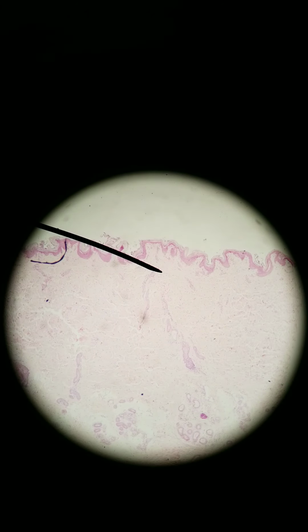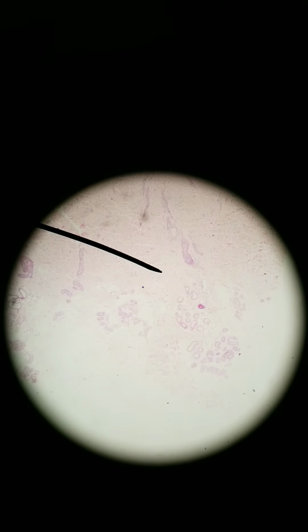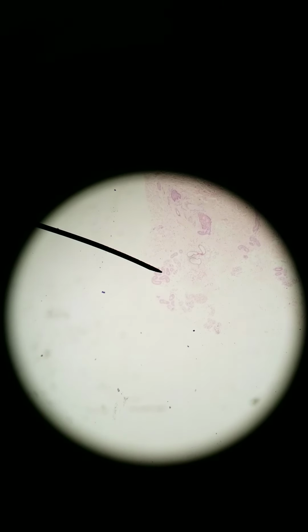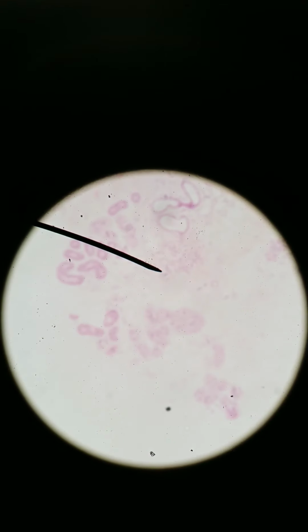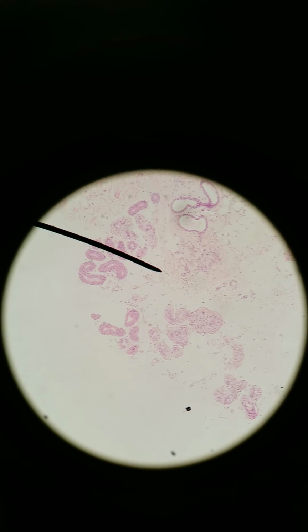Okay, so here we're looking at skin from the axillary region, the armpit. You can see our epidermis at the top and dermis and hypodermis at the very bottom. You'll hopefully already notice that there are some glands that have small lumens, like the eccrine sudoriferous that we just saw, but there's also much larger glands with really large lumens. We're going to go closer to that. So we're at 100x now, and this view will be fine.